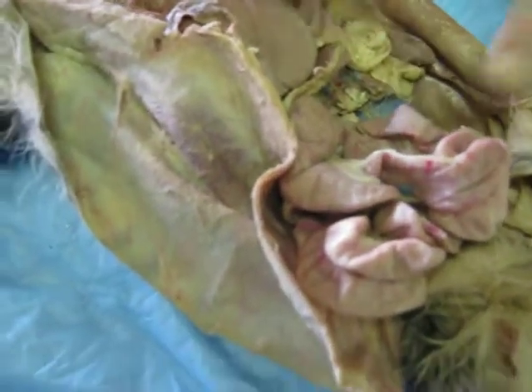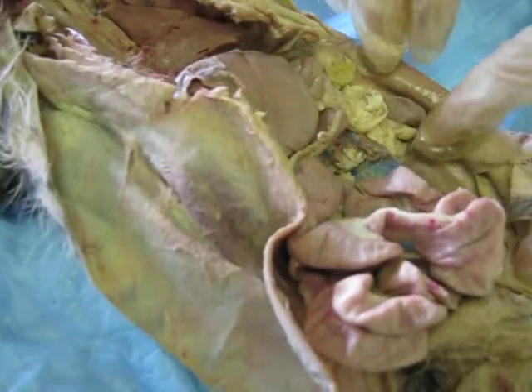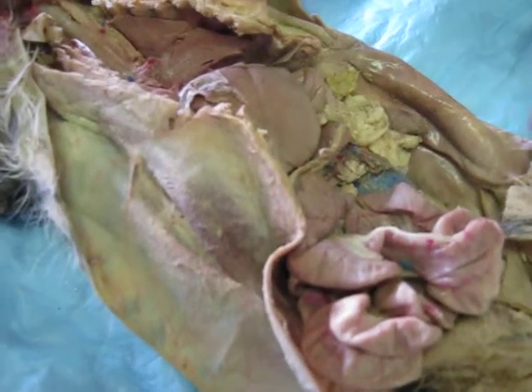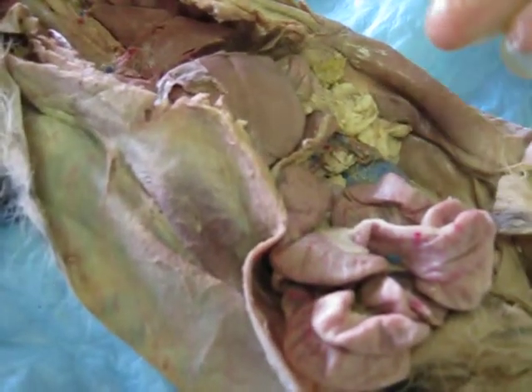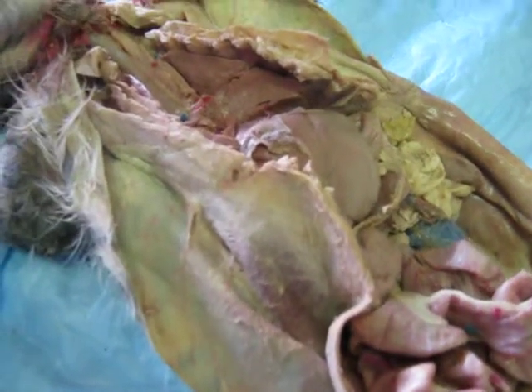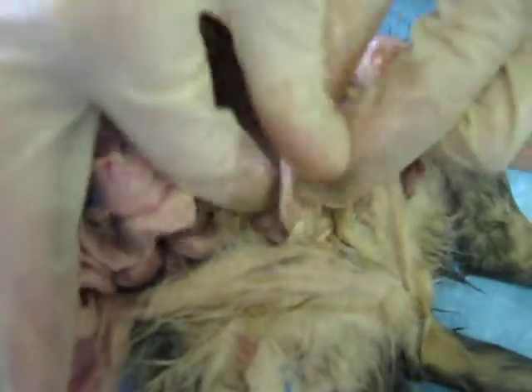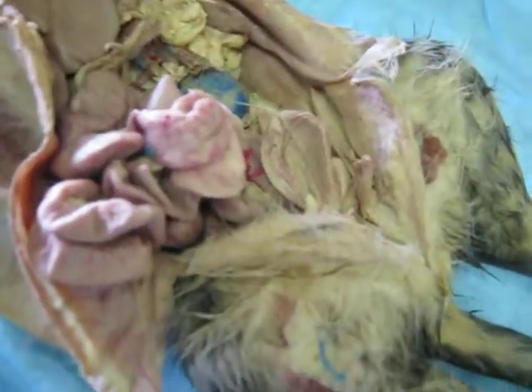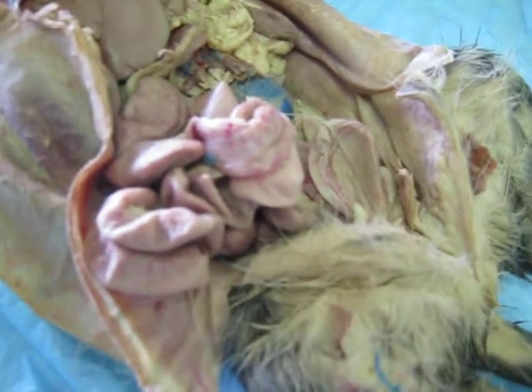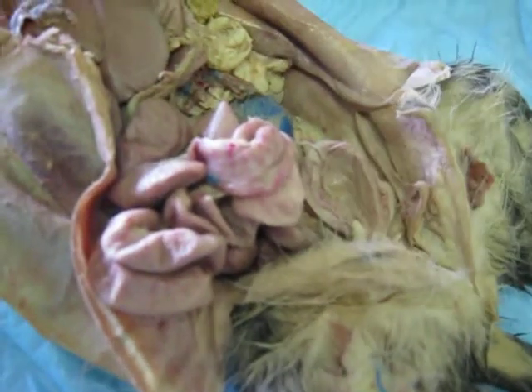Okay, the function of the kidneys is to take toxins and waste from the blood and from other parts of the cat and begin to produce pee and other forms of waste. And then from the kidneys, it moves into the urinary bladder. The urinary bladder is made to store waste until it is ready to be disposed of, specifically liquid waste.